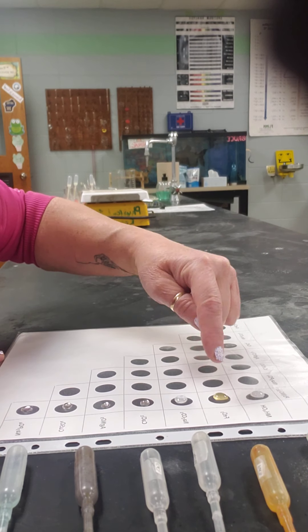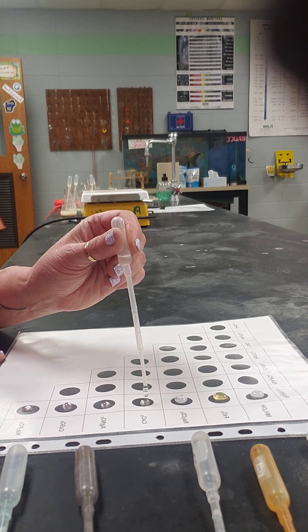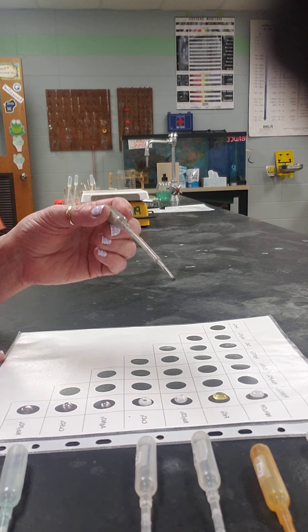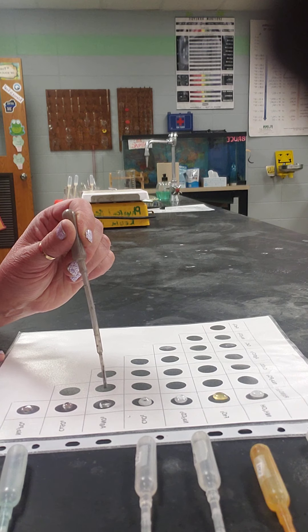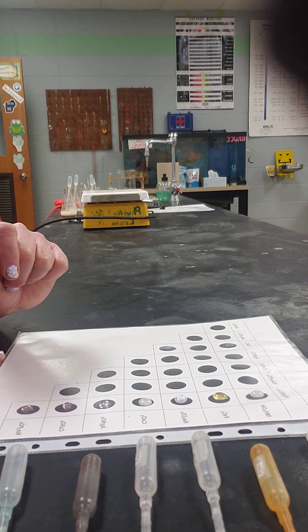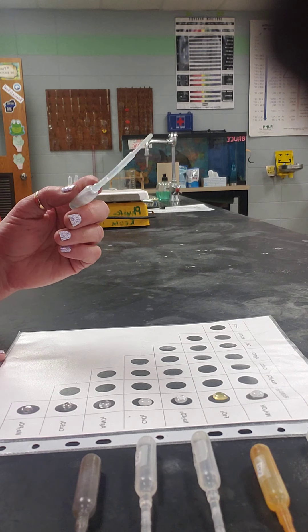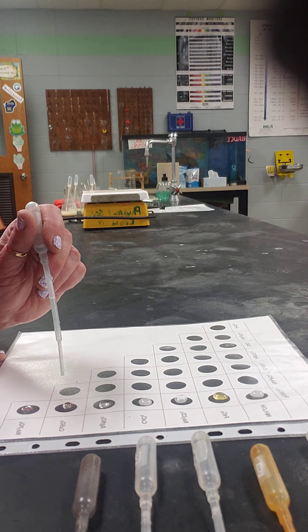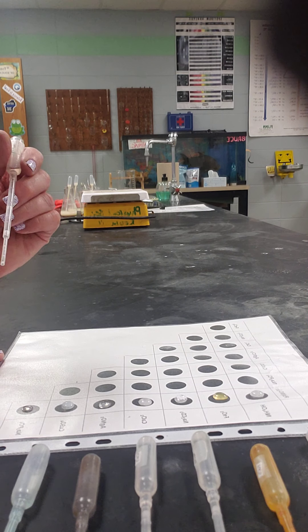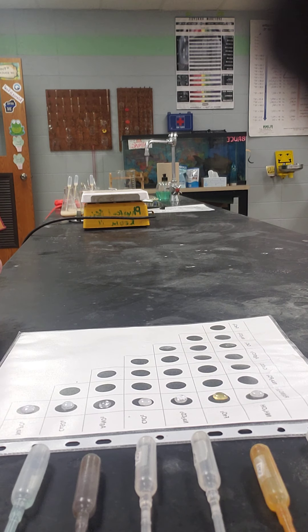Next, sodium carbonate with lead(II) nitrate — white precipitate. So far I've got a white precipitate, a brownish precipitate, a white precipitate, a white precipitate. Calcium chloride gives another white precipitate. Silver nitrate — nothing happening there. That makes sense because lead nitrate plus silver nitrate can't switch partners; they'd get the same thing, so no reaction. Copper(II) sulfate gives another white precipitate, and lastly sodium phosphate gives another white precipitate.